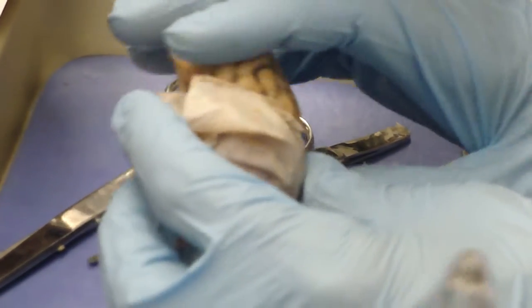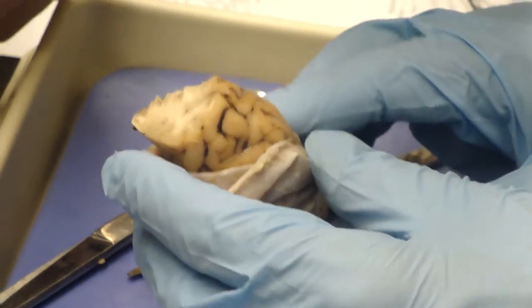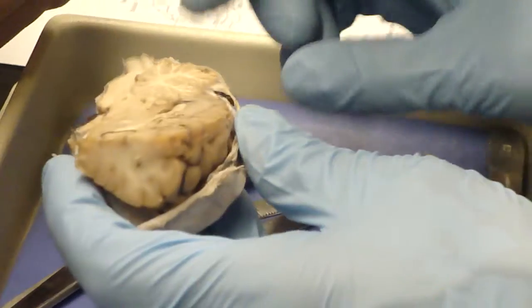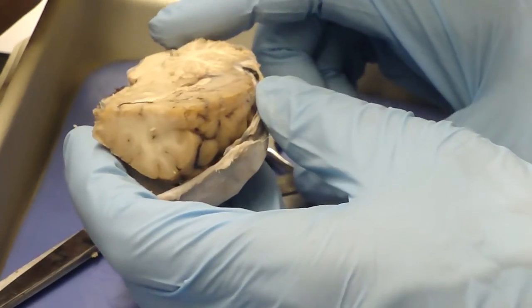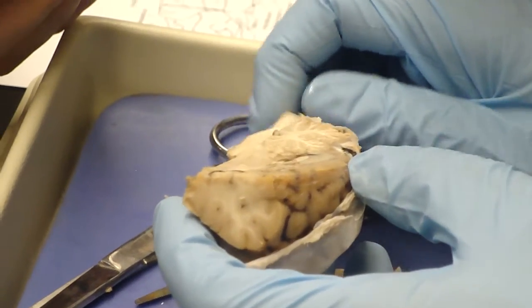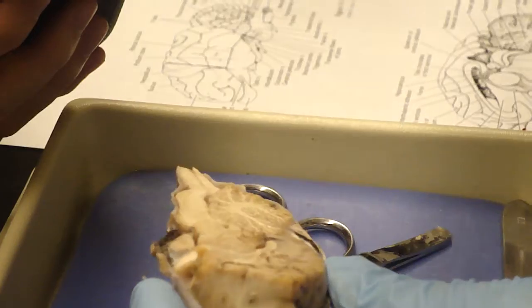The cerebral hemispheres, we think of them as having to do with thought and higher mental processes. A lot of what they do, thank goodness you don't have to think about. The cerebellum is something that you have very little thought control over. I don't know, you can manage it a little bit, I think, but it's pretty much working on its own.